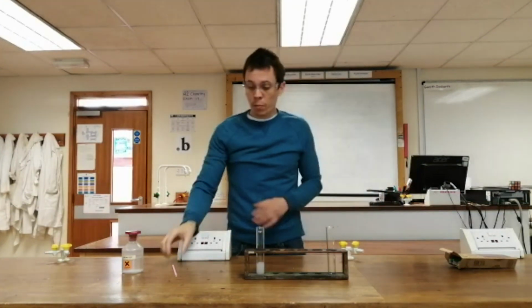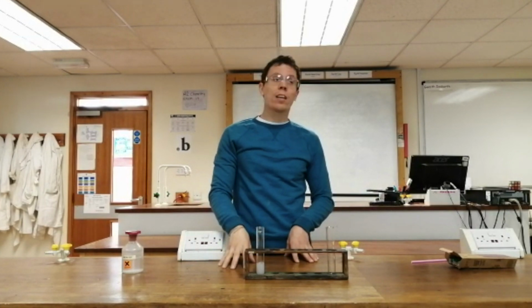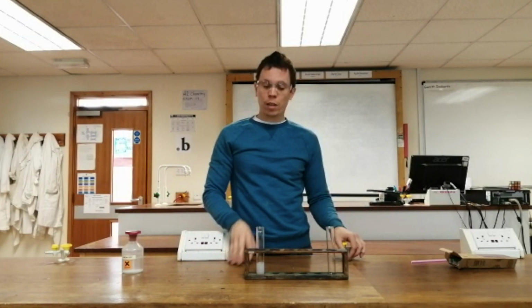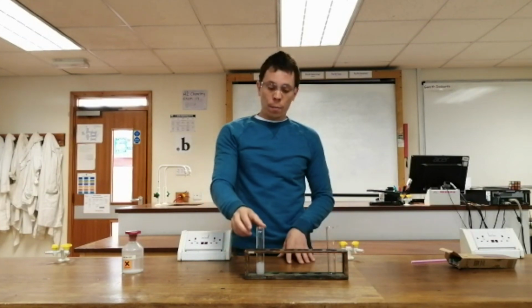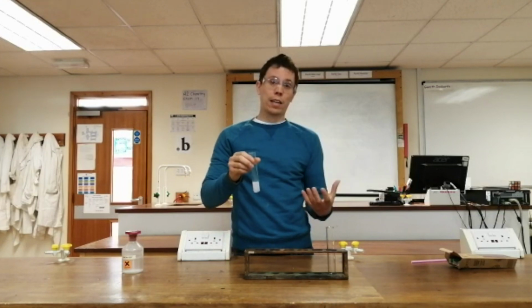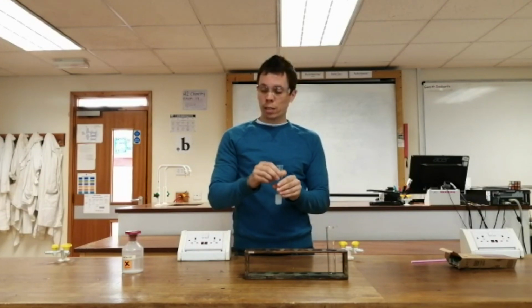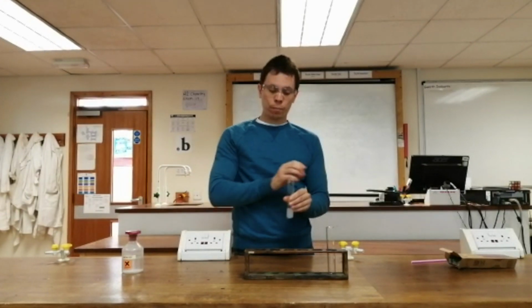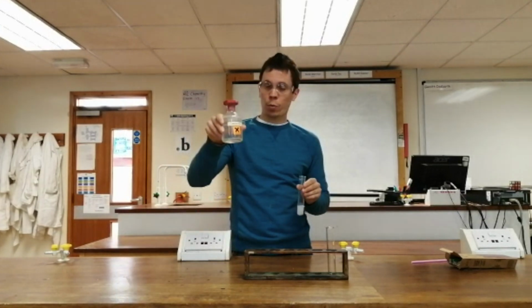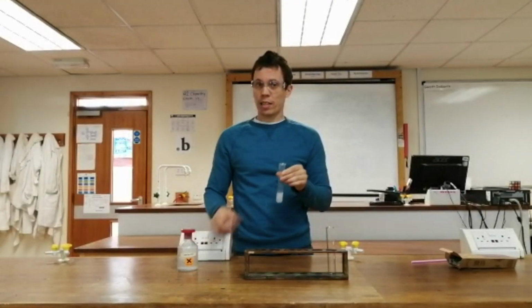Now, the biggest misconception, the biggest error I see in answering questions on this is an exam question will say, how do you test for carbon dioxide gas? And people say, blow into limewater. The only reason I blew into limewater is because I was testing the gases that I was exhaling to see if they contain carbon dioxide. In an exam question, you always need to say what you do and what you'd expect to see. So to test for carbon dioxide gas, you bubble the gas through limewater, and if it turns milky, then there's carbon dioxide in that gas.